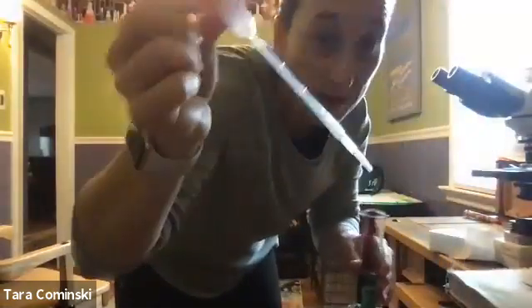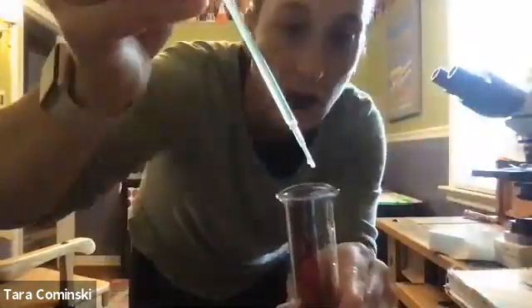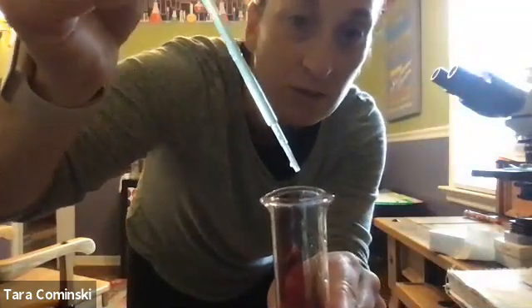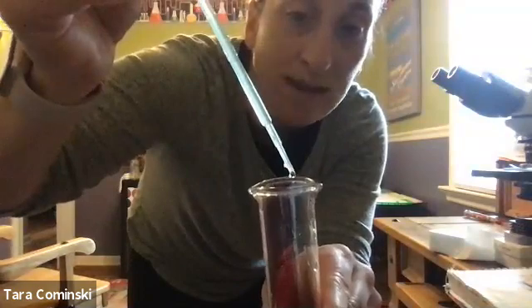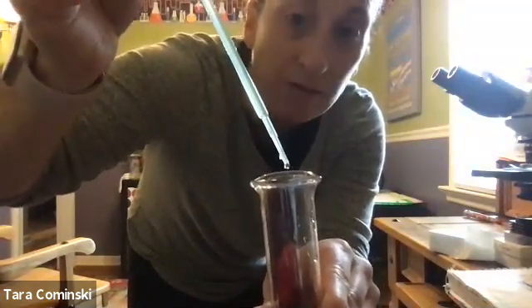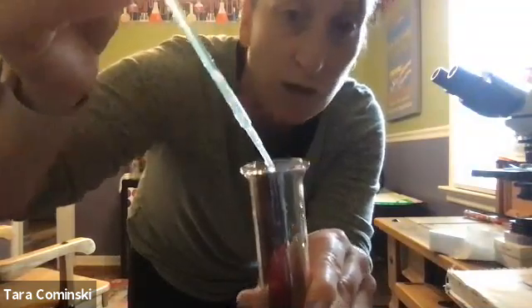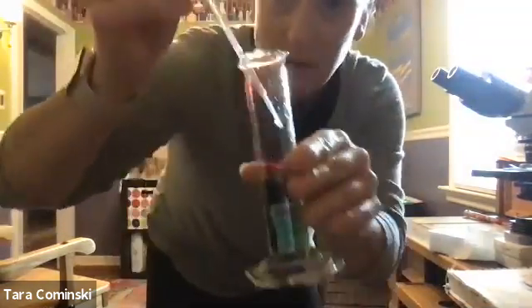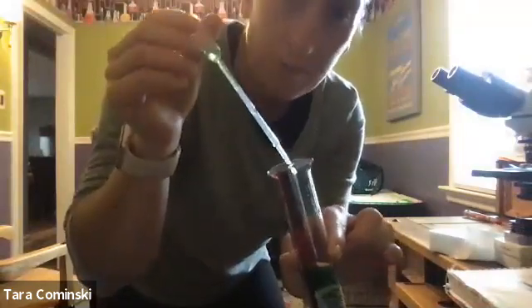Yeah, so you basically want to know if I had a dropper like this, right? How many little drops like this, I'll show you, right? Little drops, meaning you have to do it slow. 1, see my little drops, 2, 3. You want to know how many drops equal 1 milliliter. How would you figure that out? Write down, hypothesize how you would, again, using a graduated cylinder, using your dropper, how would you determine that? Okay, how are you going to come up with how many drops equal 1 milliliter? All right.